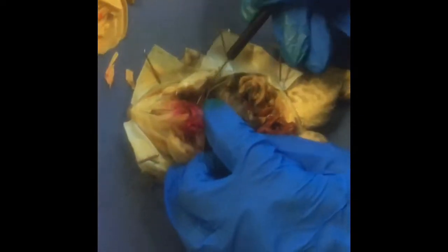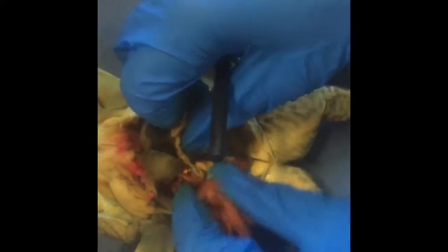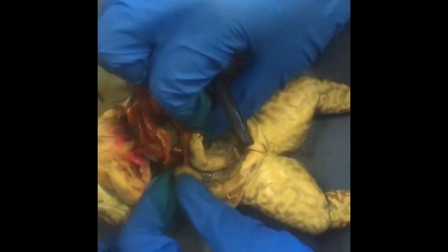Okay, so as seen in the mouth, here's a better representation of the esophagus. Here in the back, we have the stomach, which is a sac-like organ that stores food. This stomach narrows and becomes the small intestine, which is right here. The small intestine then merges into the shorter, larger intestine, which is here. I can get a better representation of it, which is this right here. And then that opens up and goes down into the cloaca, which is the opening.